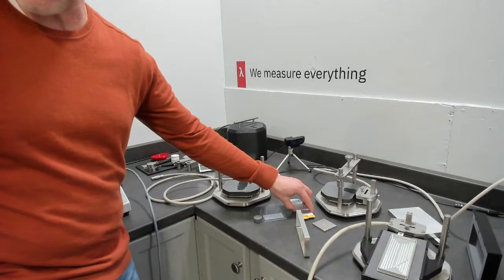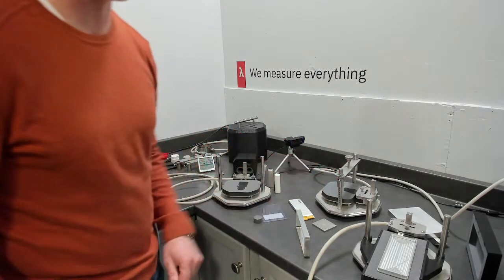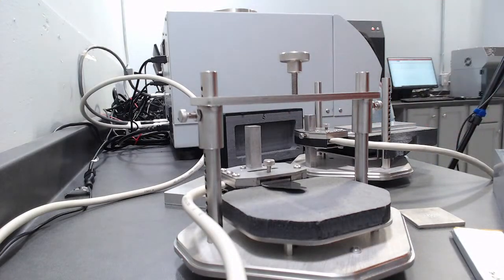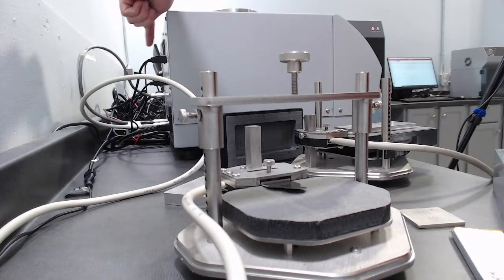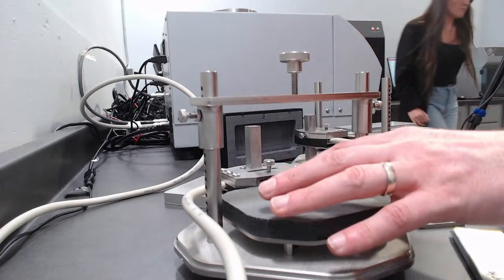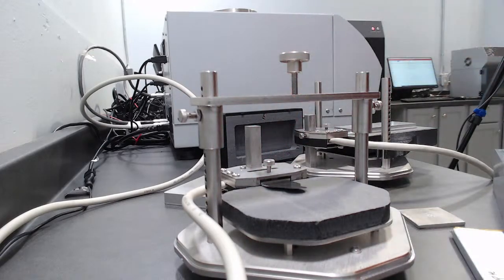So I'm going to change camera angles and just show you the sensor sample setup. Here it's another sample holder we have connected to, you can see that there's several channels in the background there. This is connected to channel 4, and I already have a sensor plugged into the adapter. There's several videos that show those basic functions of the MP-1. I invite you to look at them.